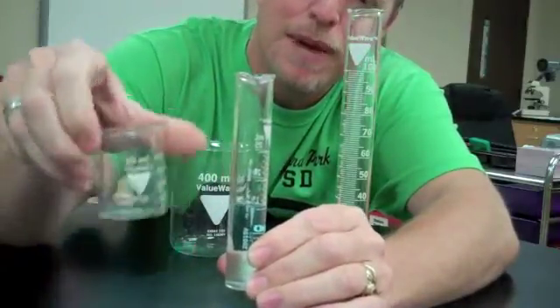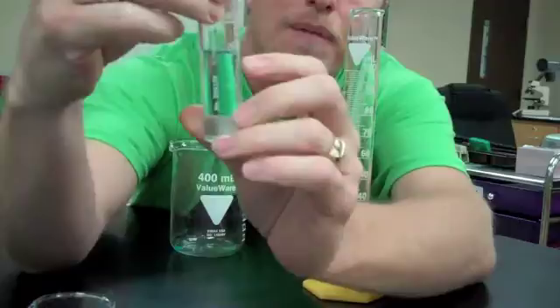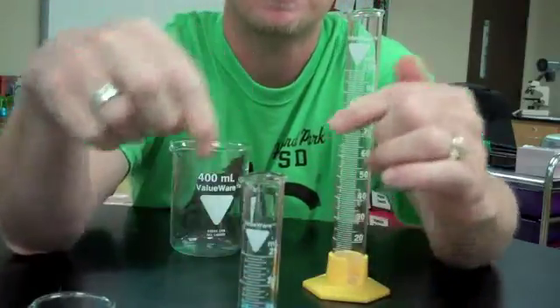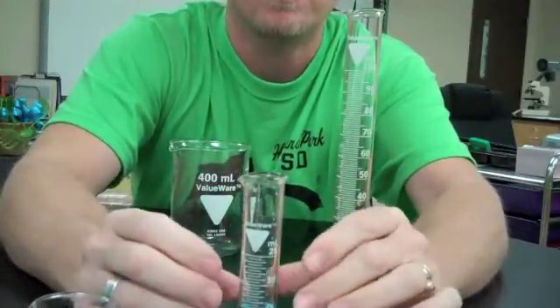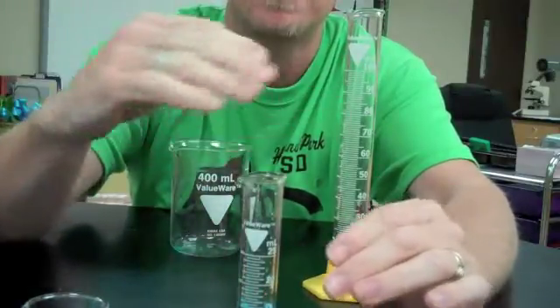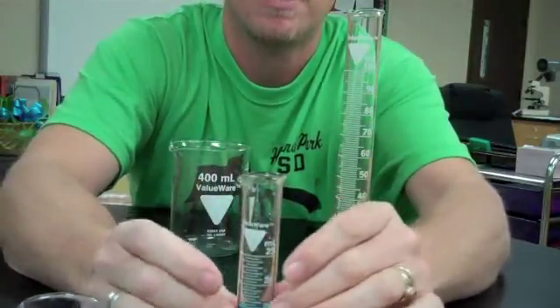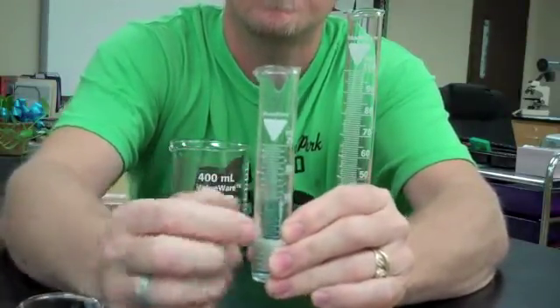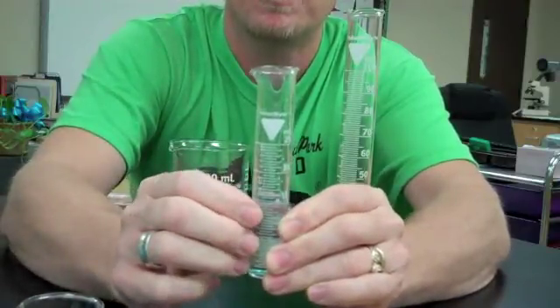This one actually registers above the 15 mark. Now in a graduated cylinder, what happens is we have air pressure inside that pushes down as the glass column wants to adhere to the liquid inside. So we end up with this little curve inside as the pressure pulls down on the liquid, and the edges want to stay connected to the side. We call that little curve a meniscus, and we always want to read at the bottom of the meniscus when we read a graduated cylinder.